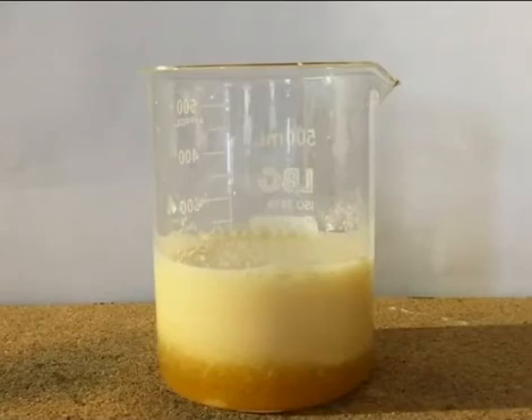The phosphate is left to dry for a few days. But if we check the reactions and follow the equations, we can see that half of the calcium chloride formed in the first step is still in solution. So to check if the calculations are right and to recover all the calcium from the bones, we need to precipitate it.